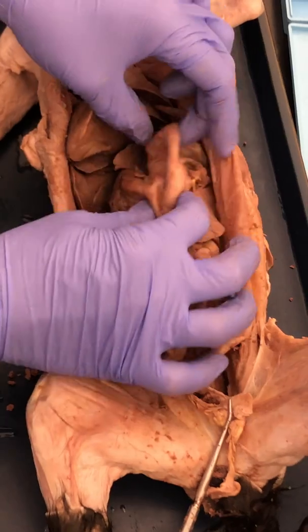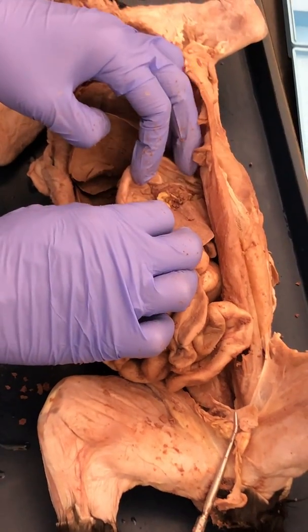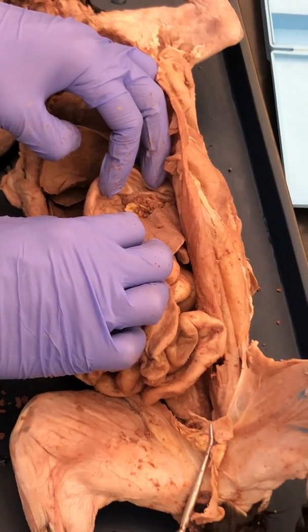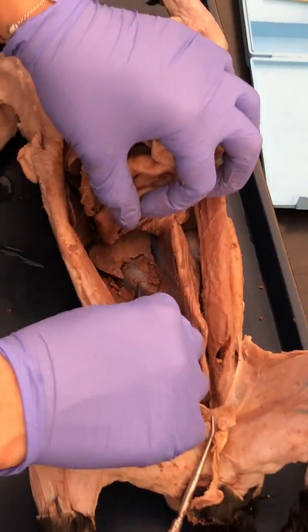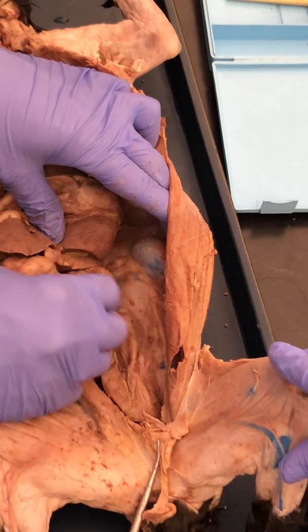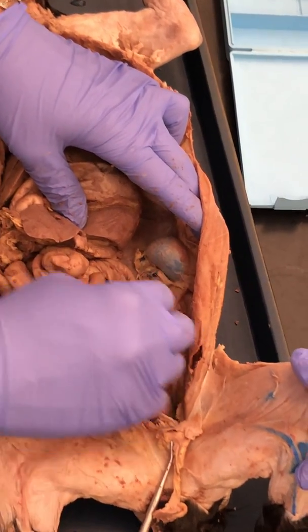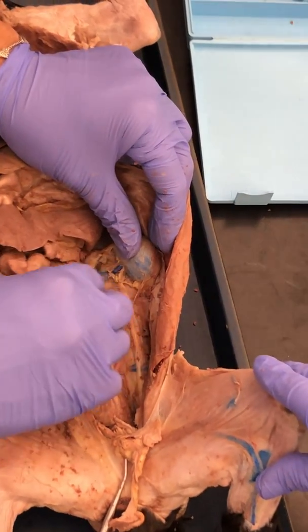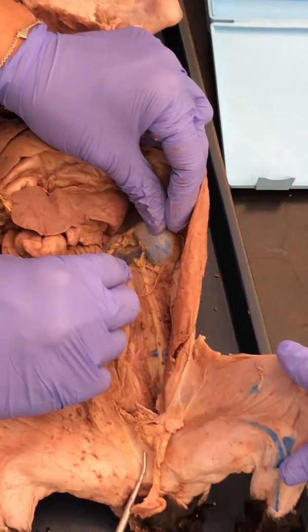Like I said, you can cut open the stomach and you can look at the rugae, but I'll leave that up to you. Okay. The kidney. Okay. I'm not going to cut the kidney open, but they're on the back wall. Okay. Y'all have done a pretty good job of clearing away the renal fascia. That's this tissue that connects the kidney to the back wall. If we clear it away, okay, right here where everything is going in or coming out of the kidney, this is called the renal hilum.